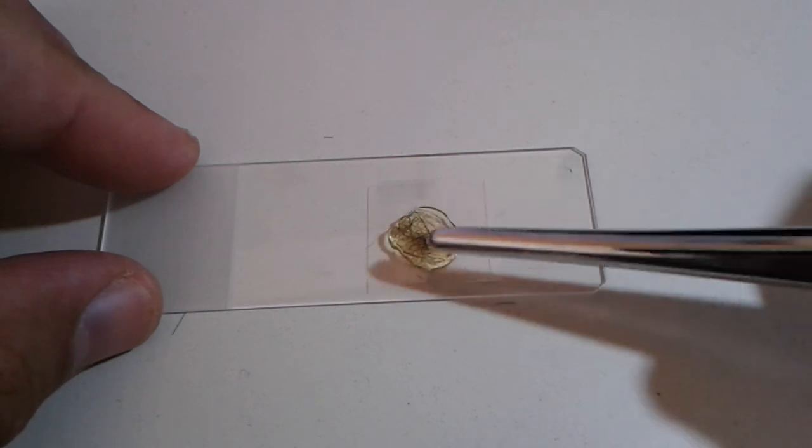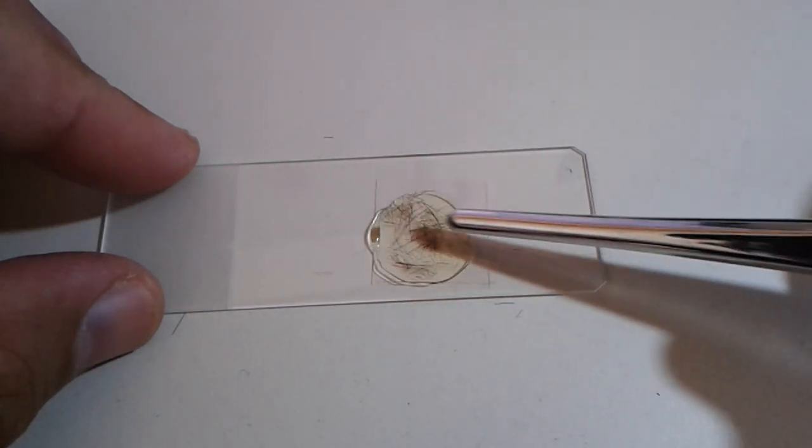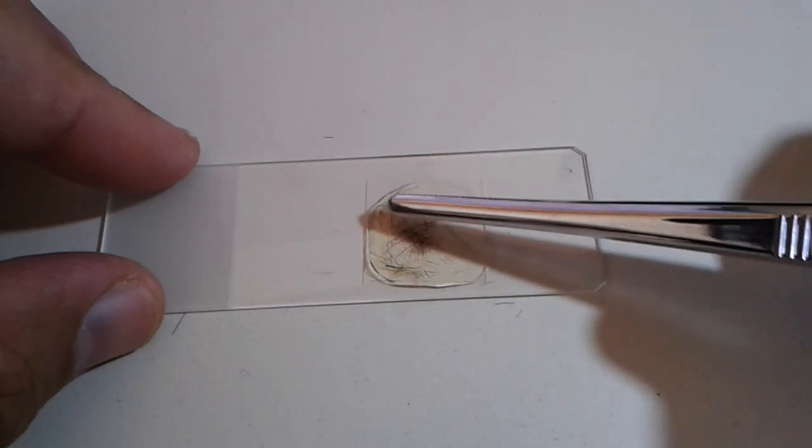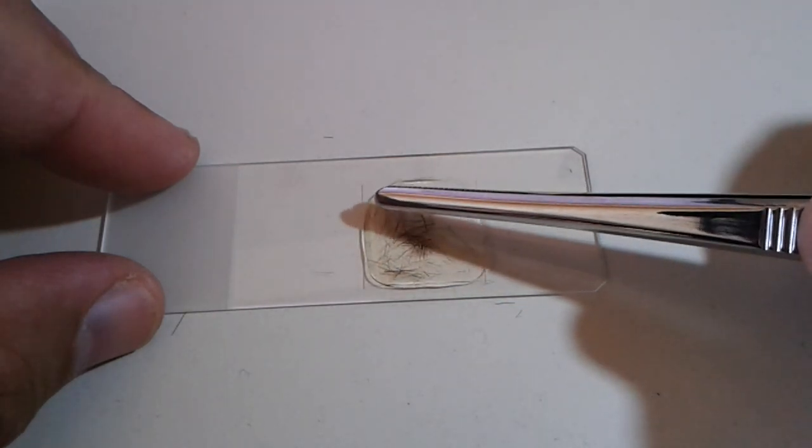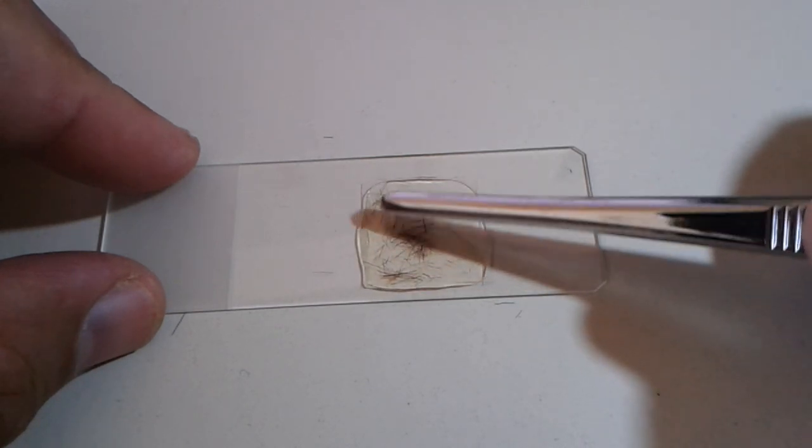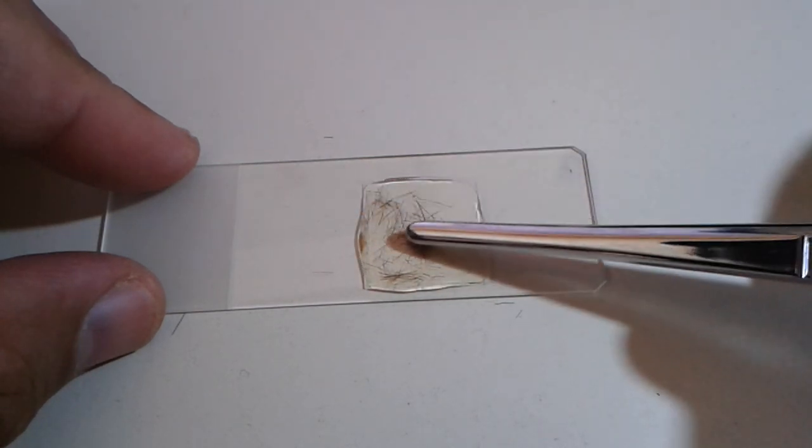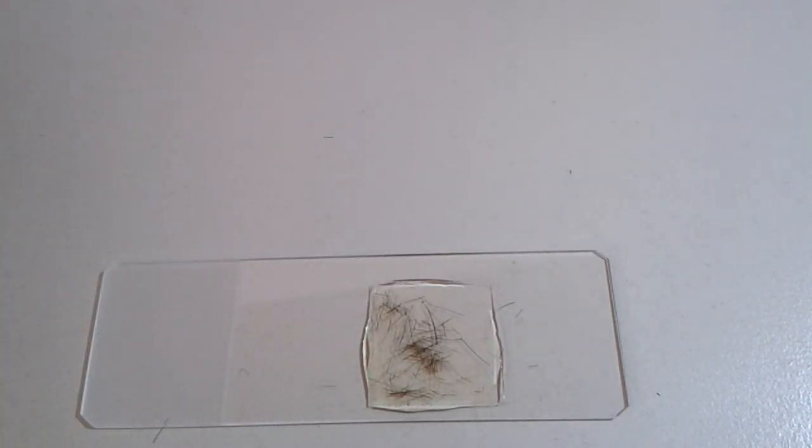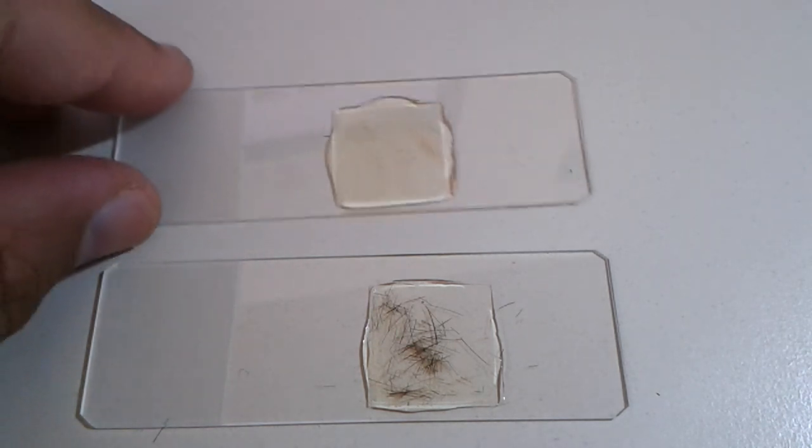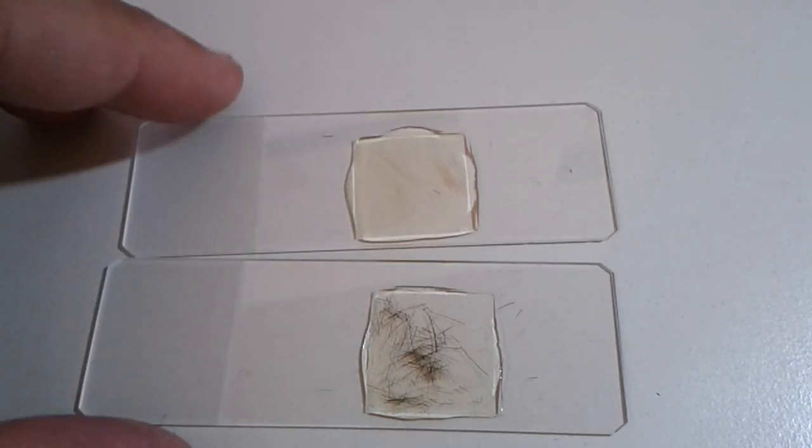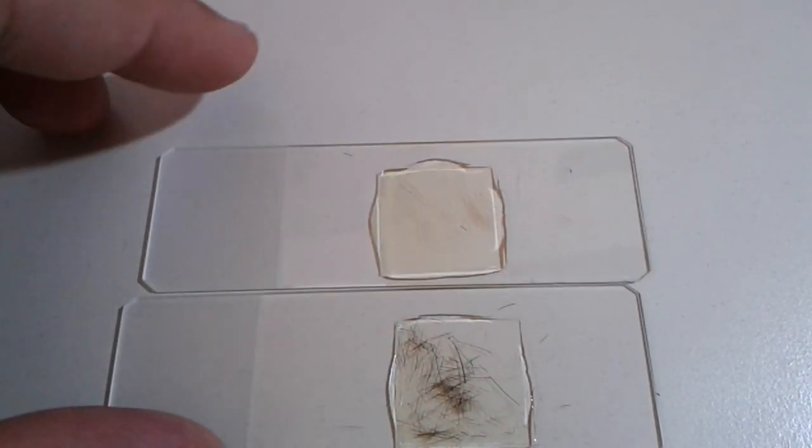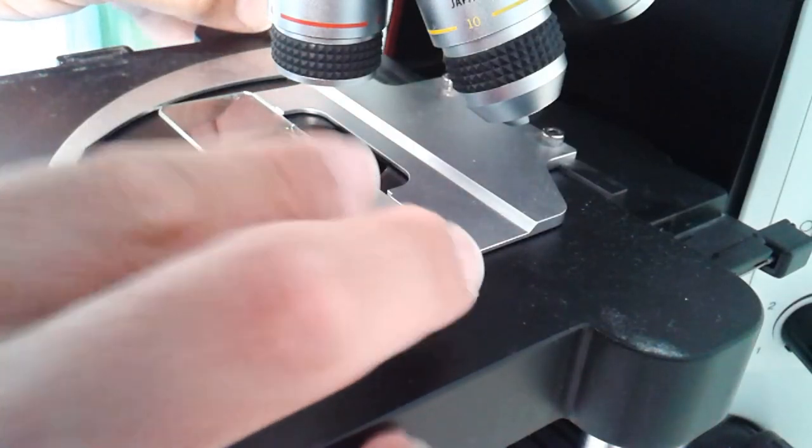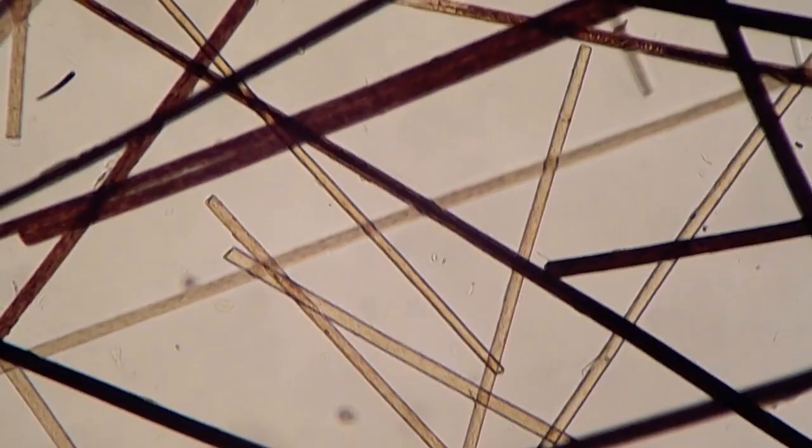And you can see that these fibers are a little bit better visible because they are pigmented. So they're darker and you can see them better and I think also under the microscope you are going to be able to see a little bit better contrast. And then you have to wait six weeks because this is how long it takes for the mounting medium to completely dry. But then you have slides that are stable for the next 100 to 150 years. So you're actually making them almost for eternity. So you have part of the dog preserved for a long time.